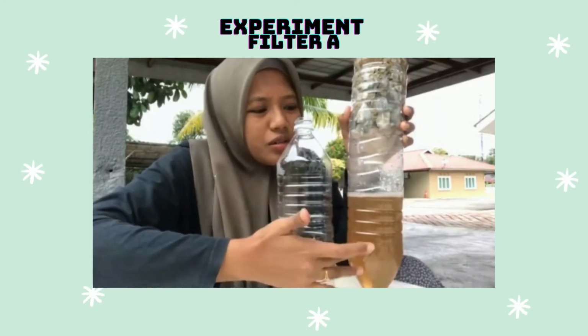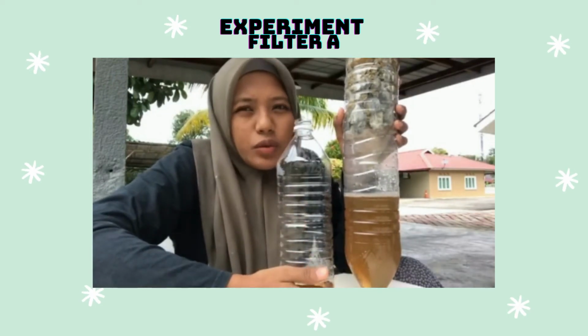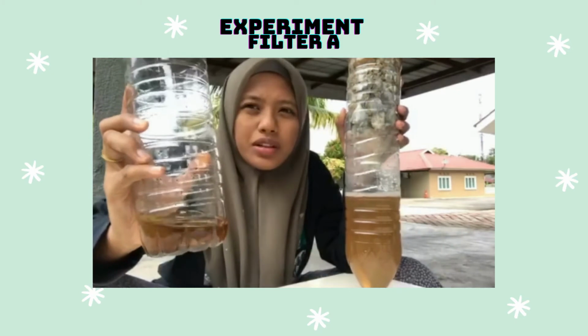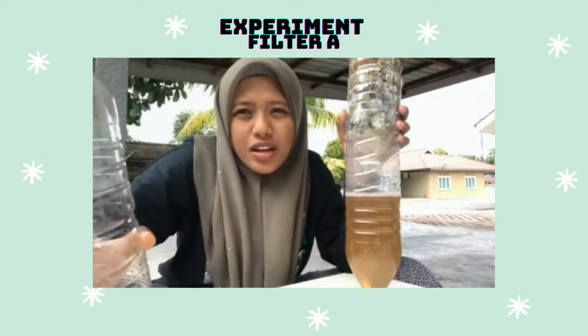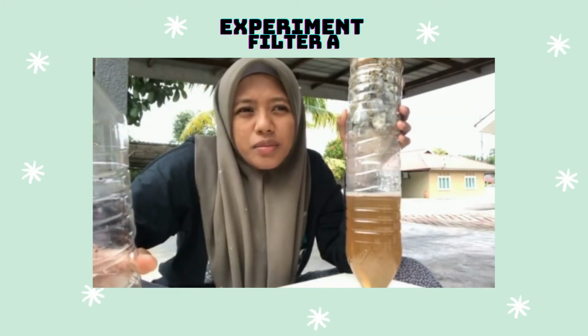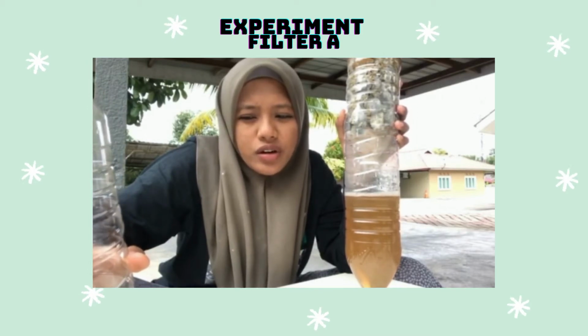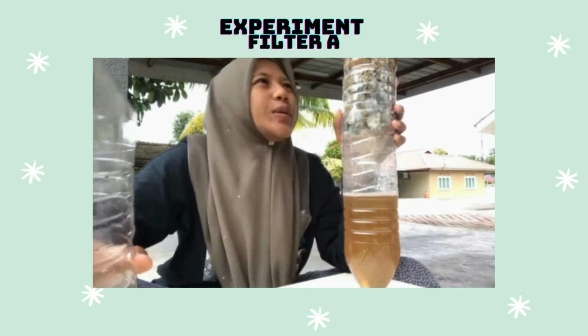The water has dropped almost half of the 1.5 liters, and this is maybe the last drop of tea water. After that, we will see the parameters we are looking for: color, turbidity, and odor. So yeah, let's go.